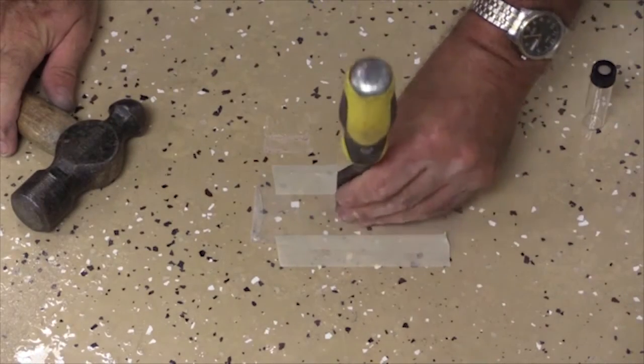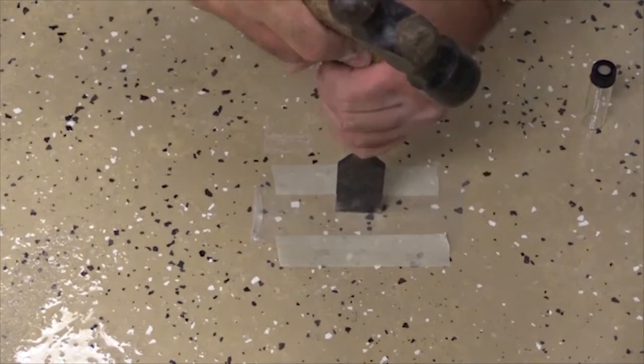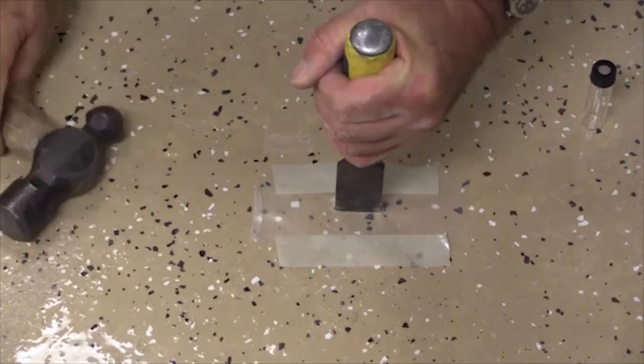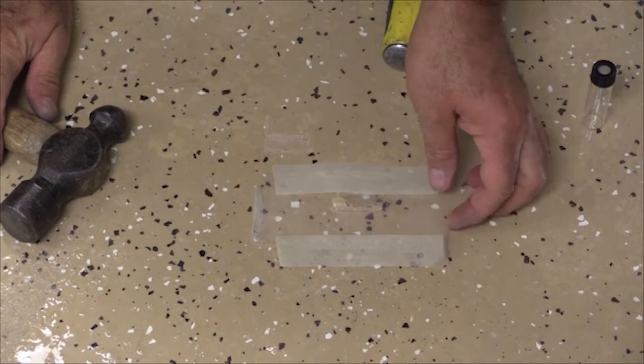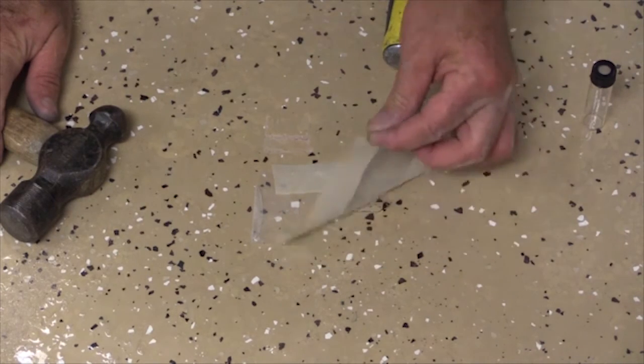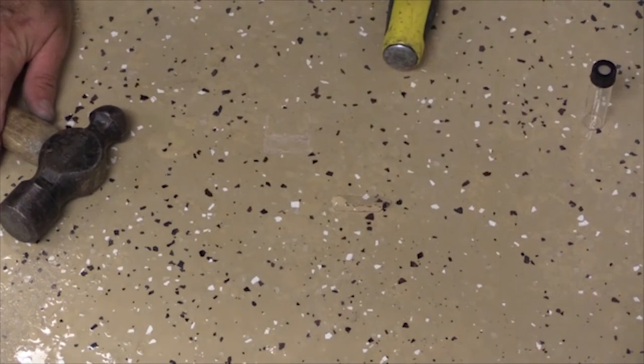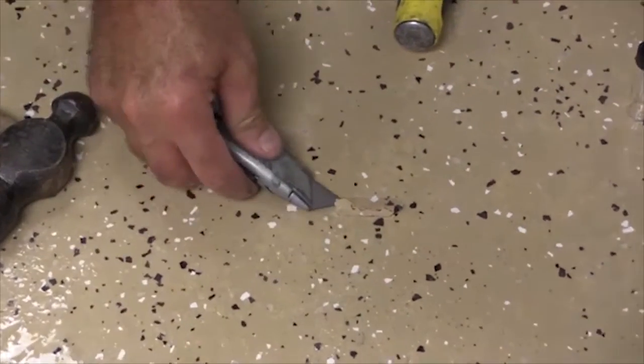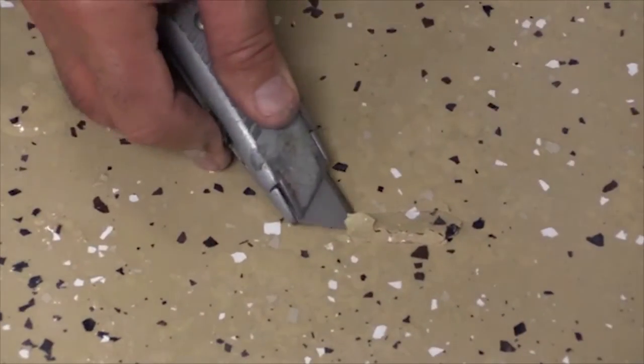Come to the other side of my sample area, repeat that. You can see that my sample is already breaking away from the surface, so what I can do then is just remove my piece. Let's just use a razor knife to disbond it the rest of the way.